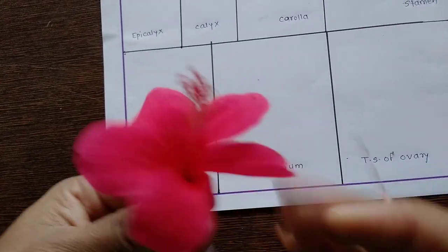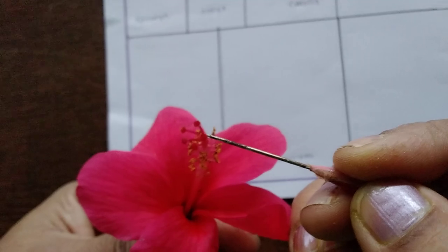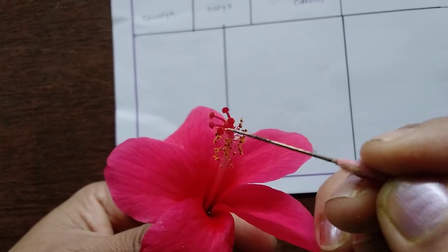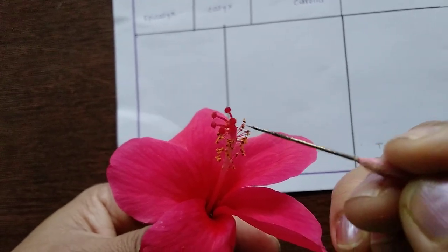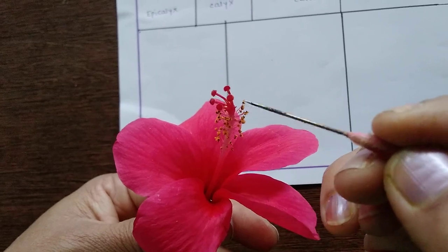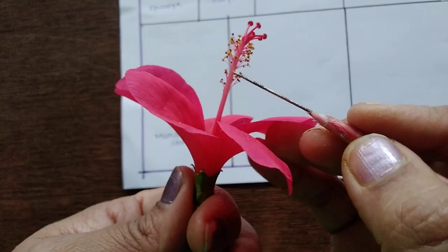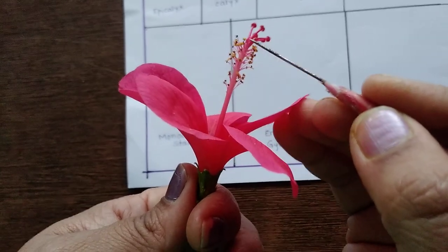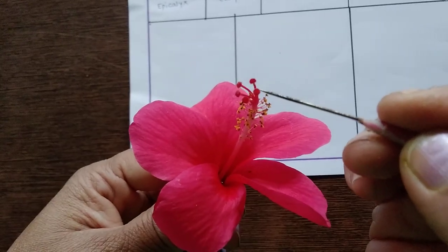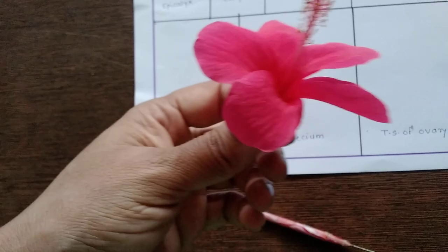The androecium and the gynoecium are the essential parts of the flower. Why? Because they take a direct part in fertilization. Androecium produces the pollen grains as the male gamete, and gynoecium produces the ova or egg as the female gamete.